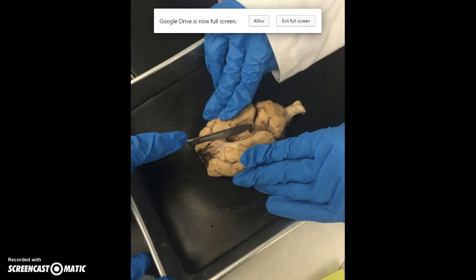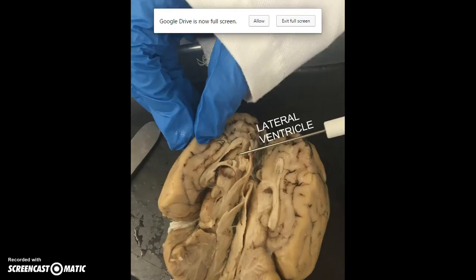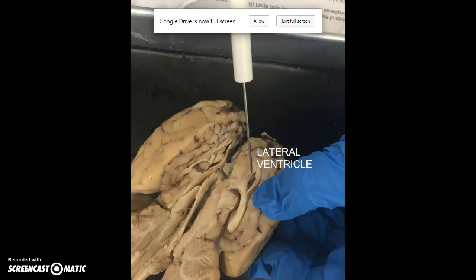By cutting along the medial longitudinal fissure, we divided the two hemispheres to get a better view of the interior of the brain. In this slide, you can view both the left and the right hemispheres of the brain. In these next slides, we can see the two lateral ventricles, one in each hemisphere of the brain.